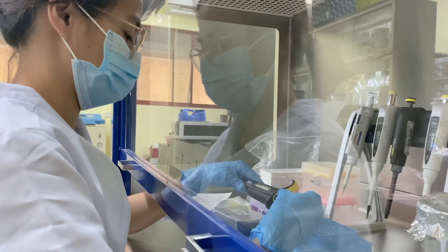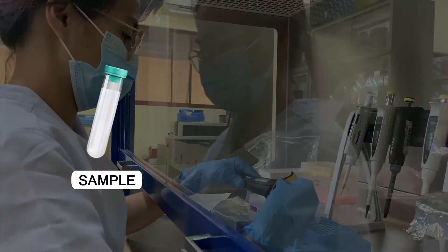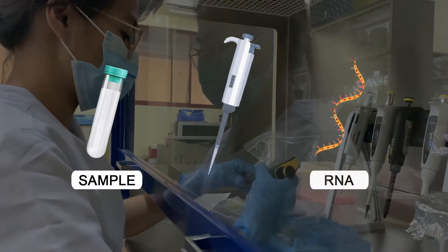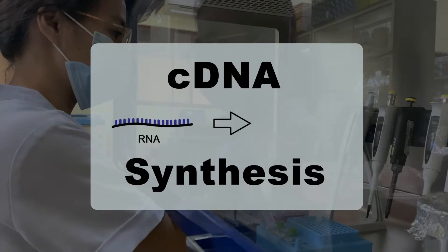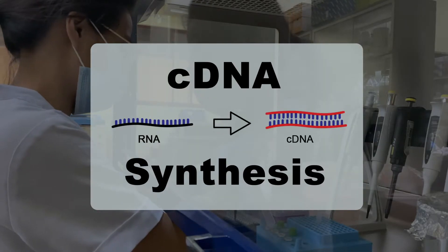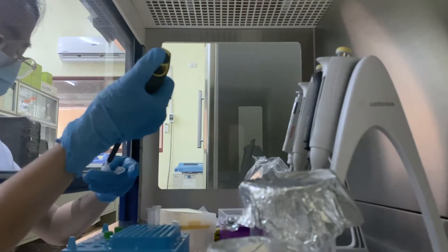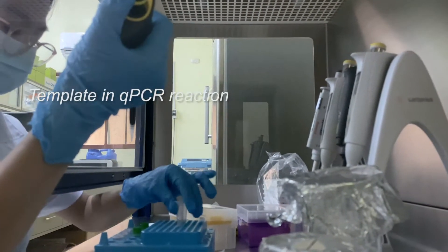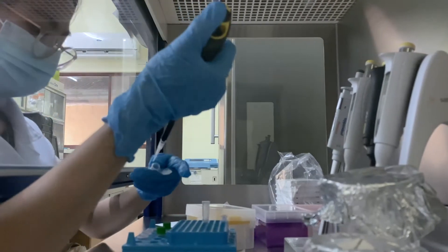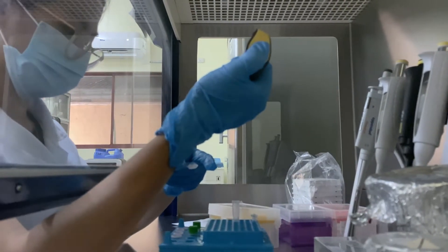The workflow of gene expression analysis in the laboratory starts with the extraction of RNA from the samples. RNA is then reverse transcribed into complementary DNA, or cDNA. The cDNA produced becomes the template in qPCR reactions to detect and quantitate gene expression products.